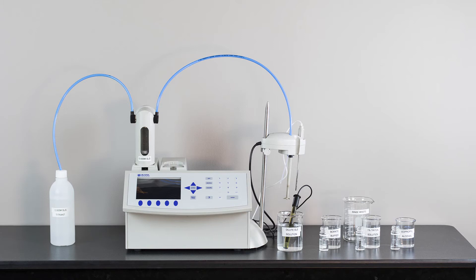Here, we have everything we'll need for our test. We have our automatic titrator, our nitrate electrode already filled with electrolyte, our burette containing sodium lauryl sulfate titrant, and all our sample preparation reagents.